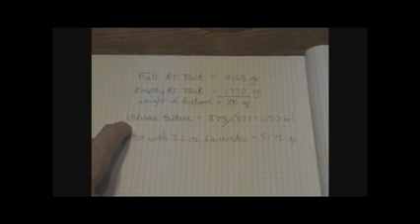Another way to do an extraction — which would actually increase efficiency — is instead of cooling the recovery tank, you can place the supply tank into about 100 to 110 degree water. This raises the pressure of the supply tank; the higher the temperature, the faster the speed. Don't go above 110°F — that's the max. It will increase the pressure about 25 to 30 psi. Open the ball valves the same way and the pressure will push the solvent through the plant material. The fastest I've done it is about one minute at 110°F.